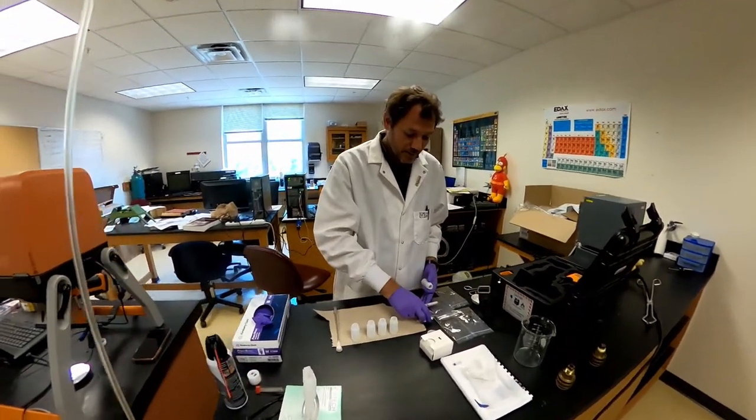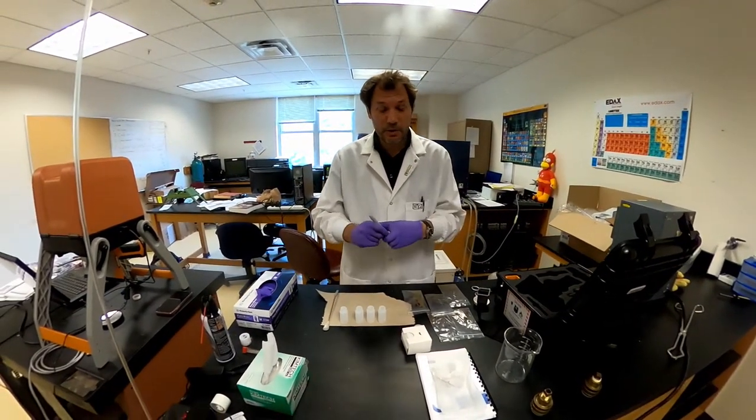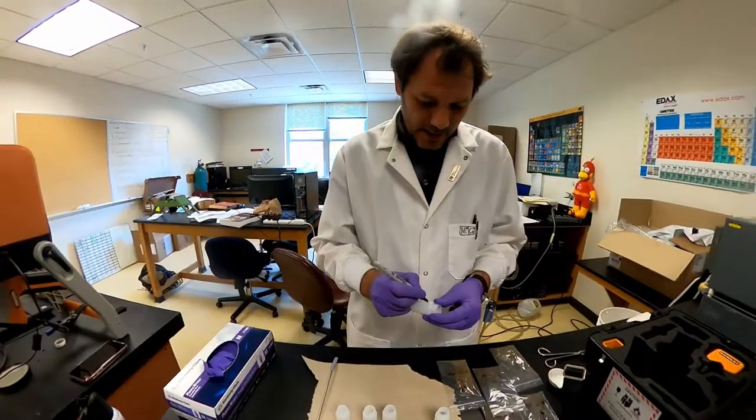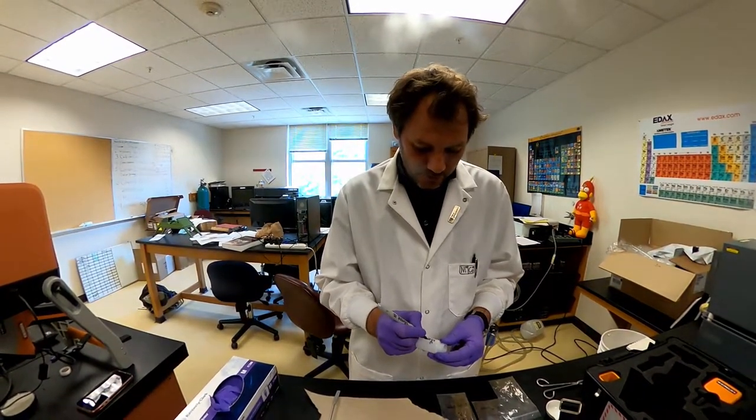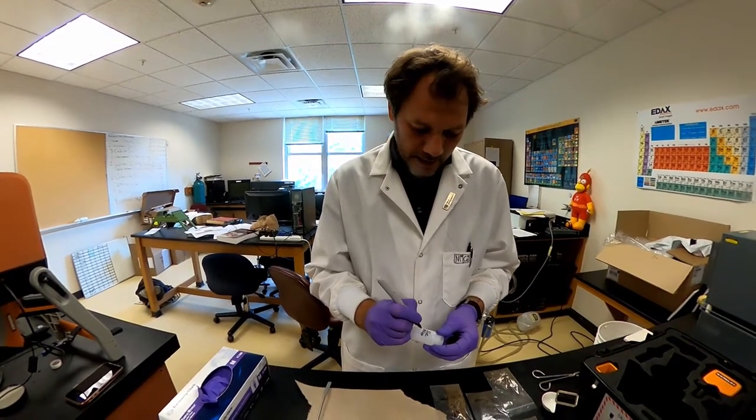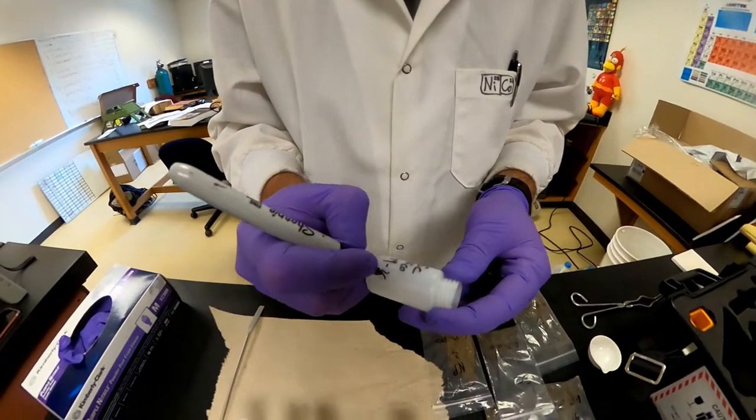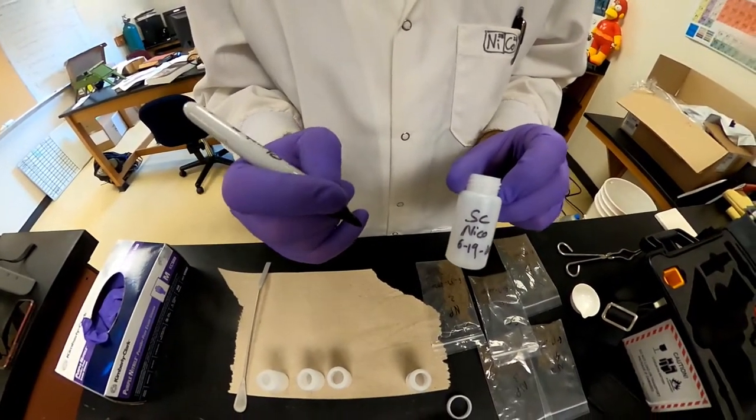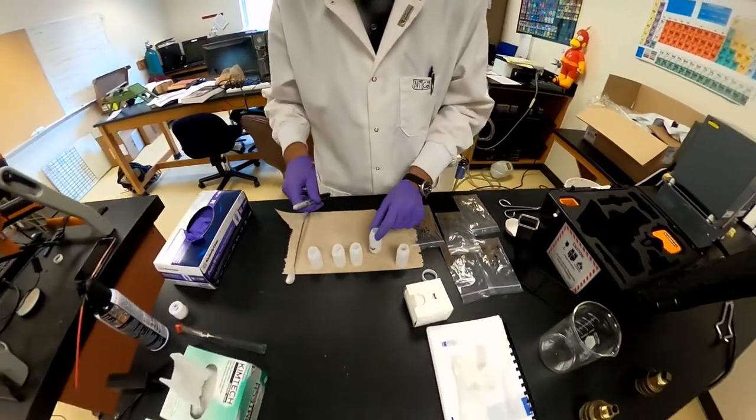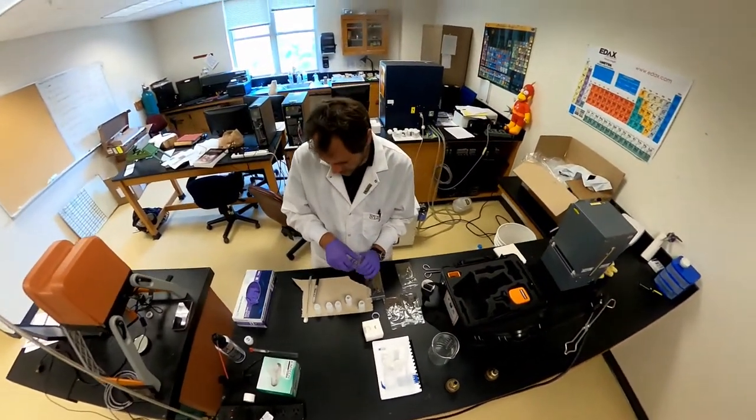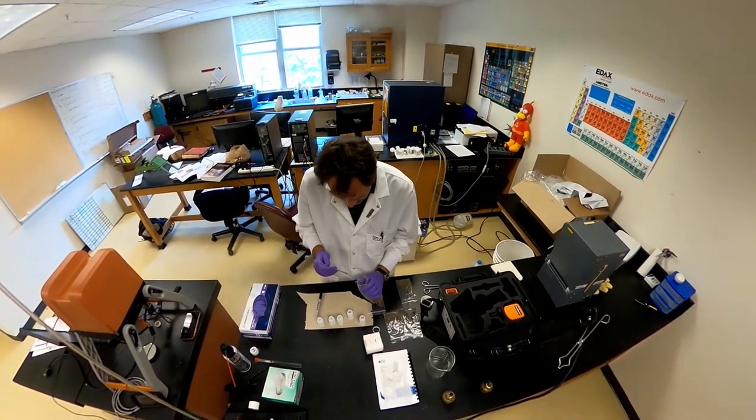When we change sample location or sample container, it's very important to make sure that we record the name of the sample properly, SC, NICO, and the date, and we keep the date at which it was sampled, and here is our sample container, and I will basically just transfer the sample into this new vial.